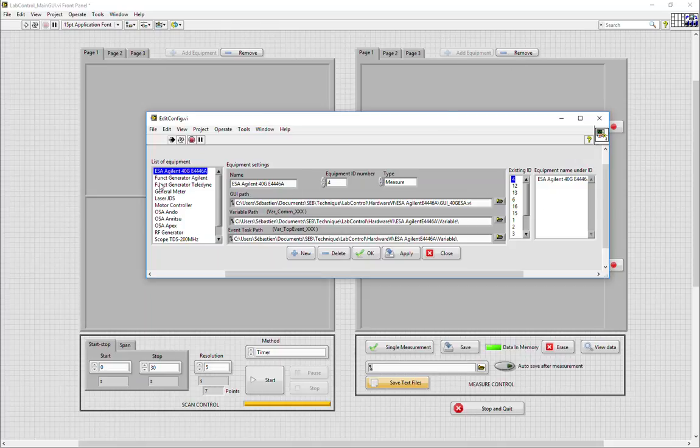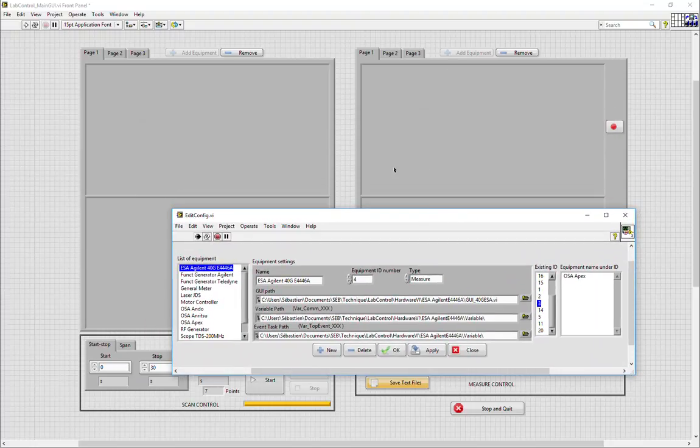If you have several VIs that are related to the same equipment, the little panel here can allow you to see which number corresponds to which equipment VI. Each GUI that you create has to have a GUI file path, which is the VI that is put inside the main GUI in the subpanel, which has to have a defined space as defined here in the main GUI.